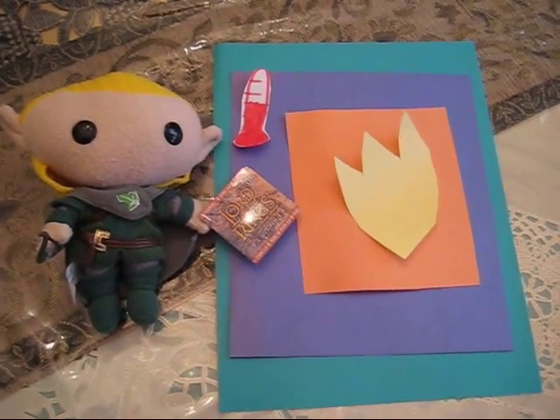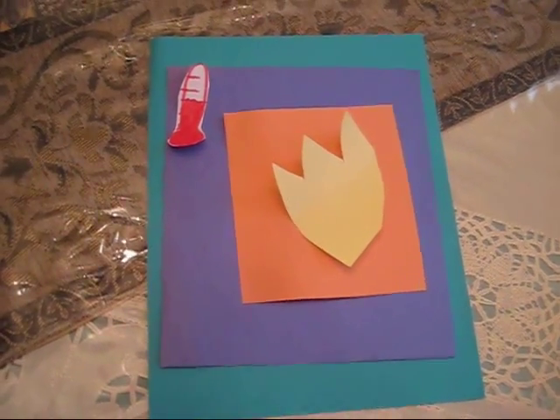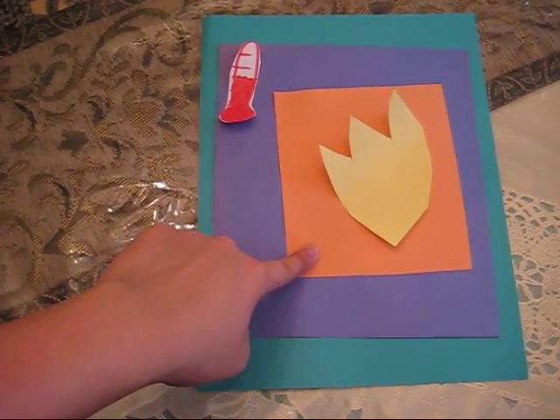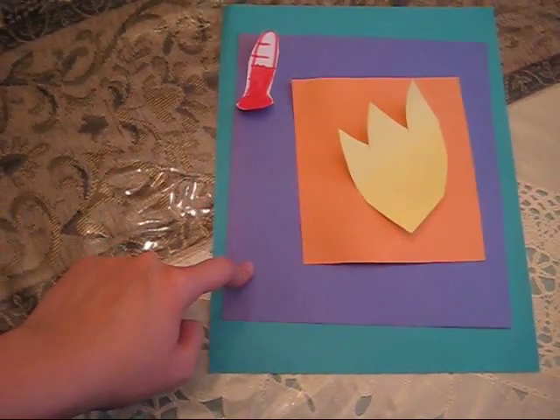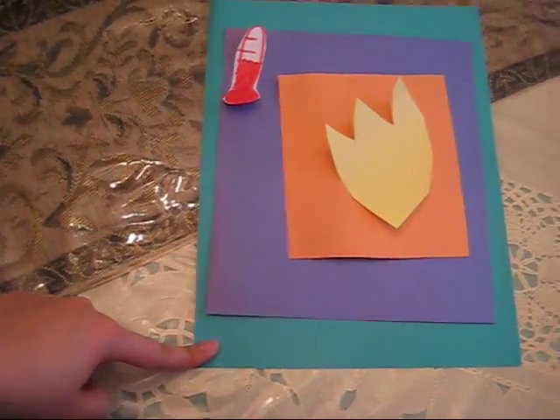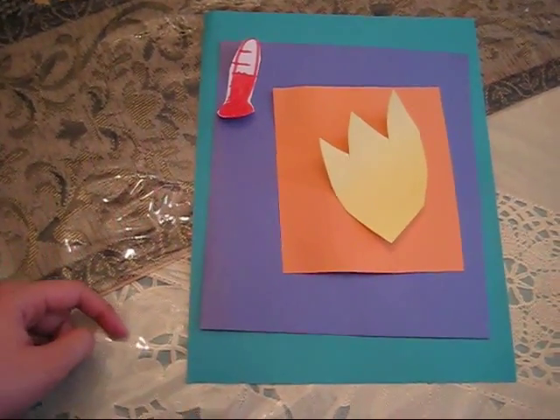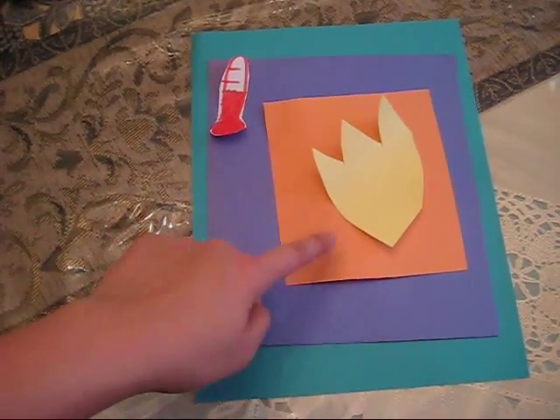This device is called a bomb calorimeter. First, there are three chambers. One: the stainless steel closed vessel that acts as a conductor. Directly outside it, a container with water. And directly outside of that, another container with water. We place a small sample — liquid or solid — of maybe one to two grams of food in the closed vessel.